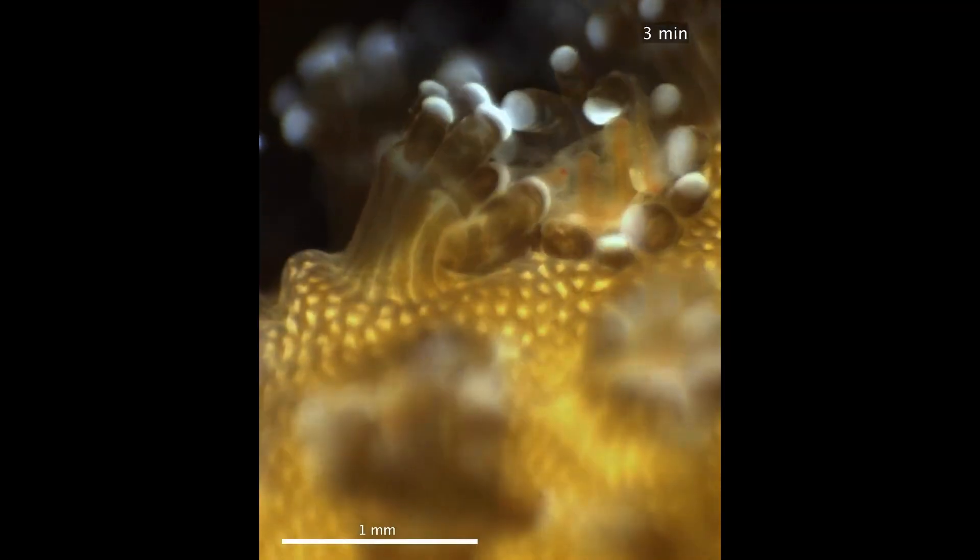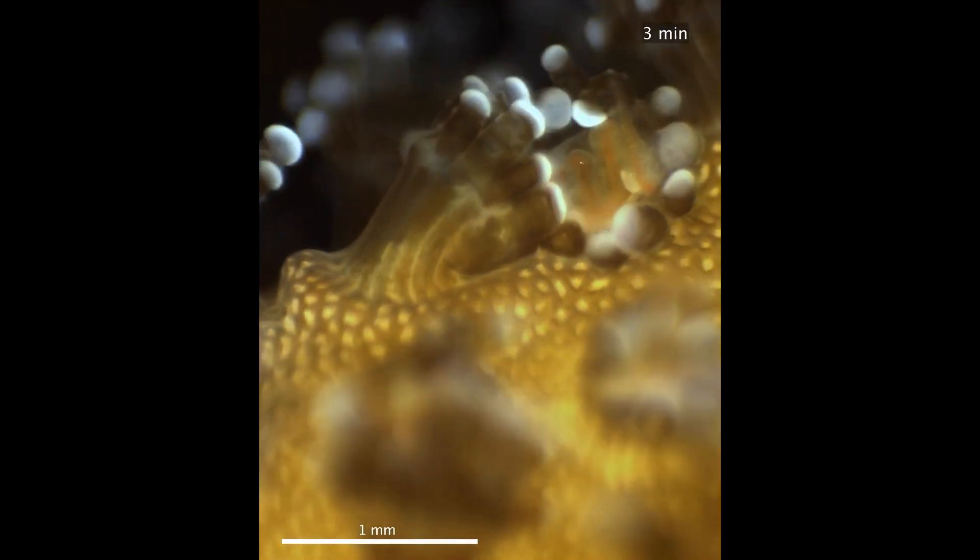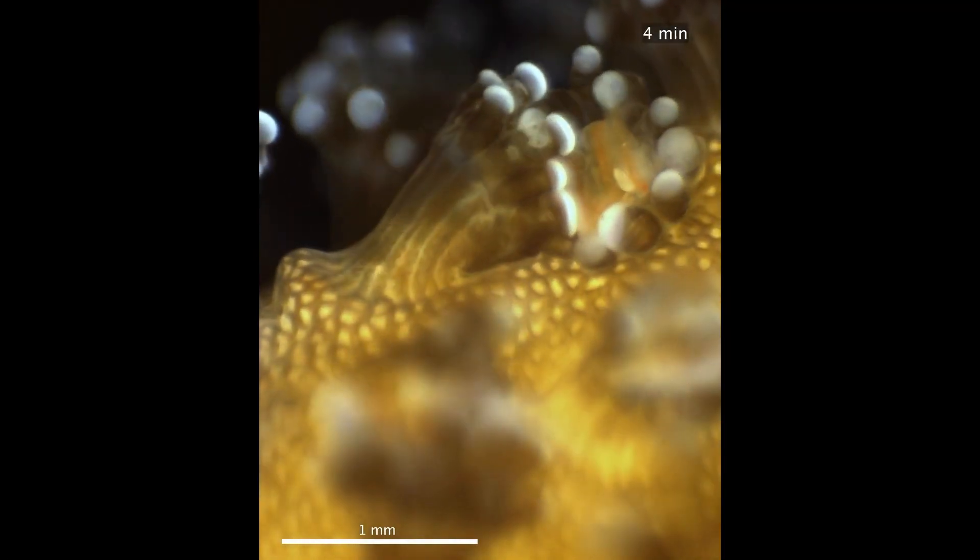My name is Andrew Mullen. I'm a PhD student at the Scripps Institution of Oceanography at the University of California San Diego. My work focuses on designing instruments that operate in the ocean, specifically building systems to take microscopic pictures in the underwater environment.